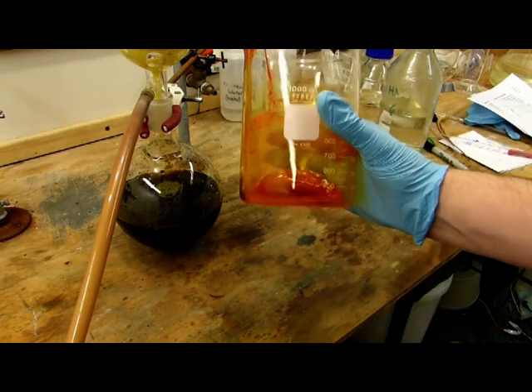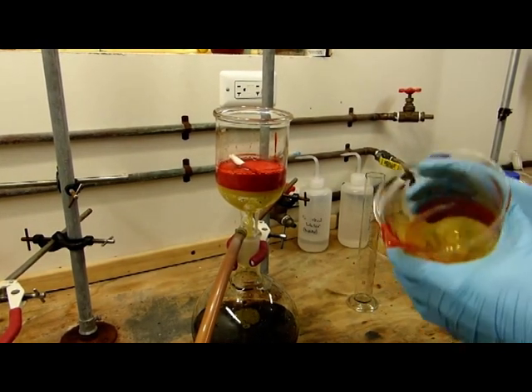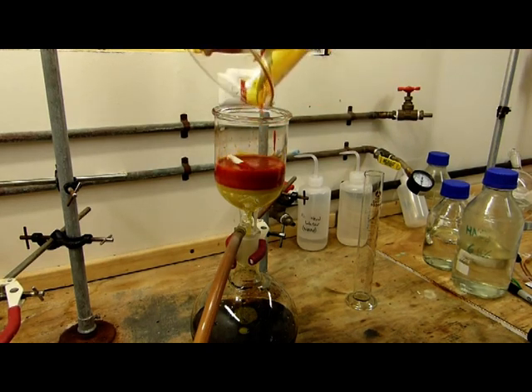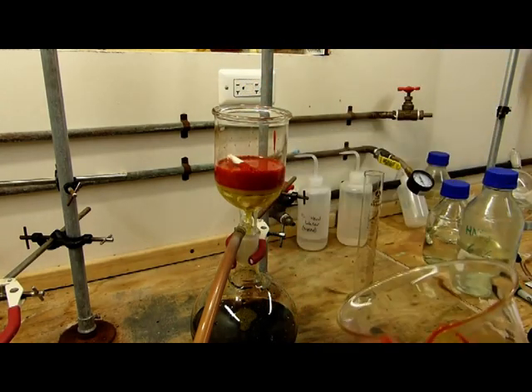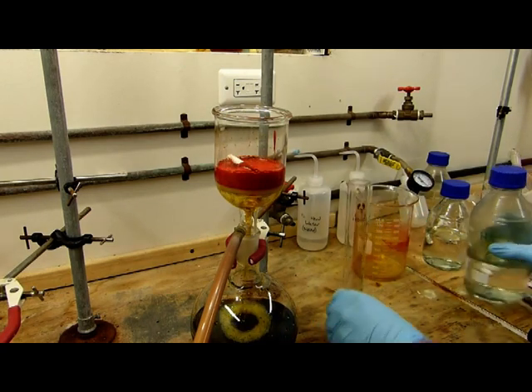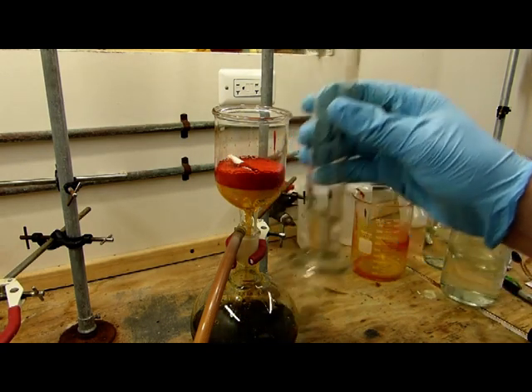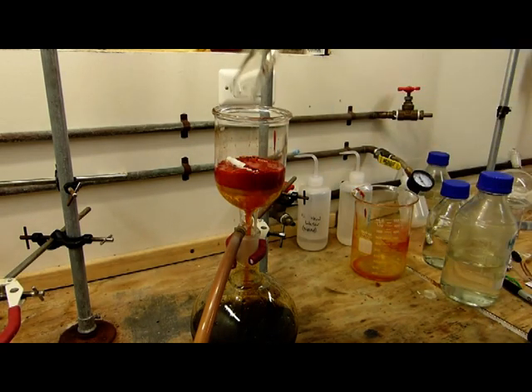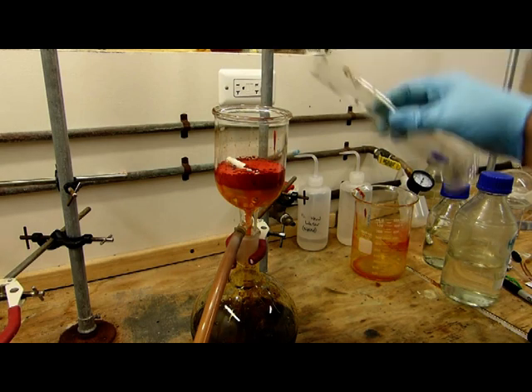Of course goggles here are a must. If you get any of this in your eye, any of the nitric or the concentrated sulfuric with the chromium trioxide dissolved in it, it's going to be a really bad day for you. Wash number one, all at once. That's close enough for this beaker. I'll just measure out 20 more milliliters here. All at once so it flows through in a nice even layer. You see that pulled through much faster because we got a lot of the sulfuric acid out of it.